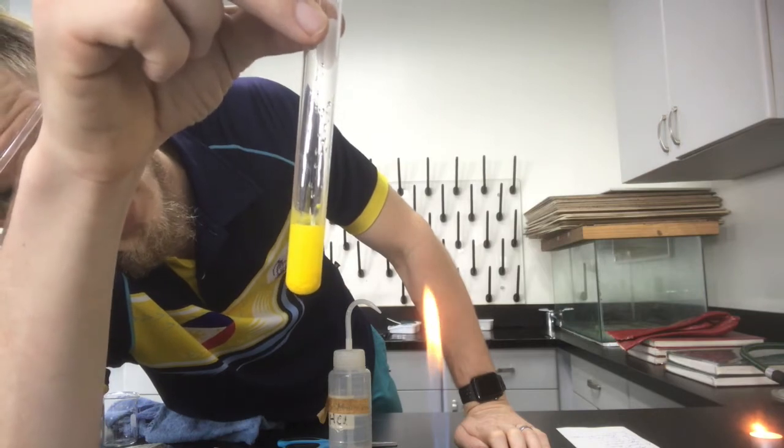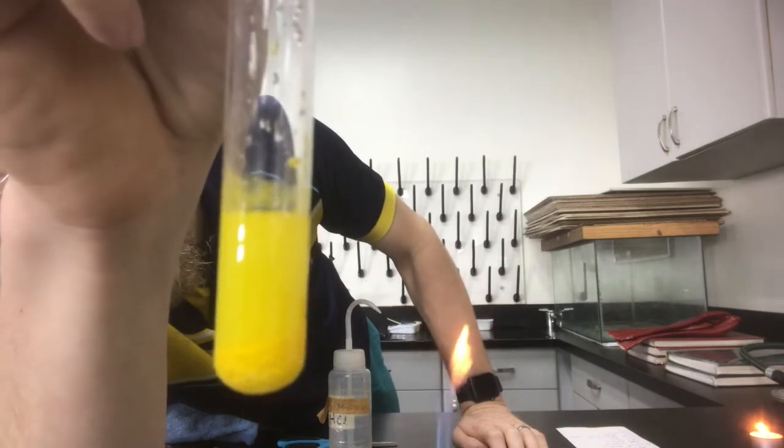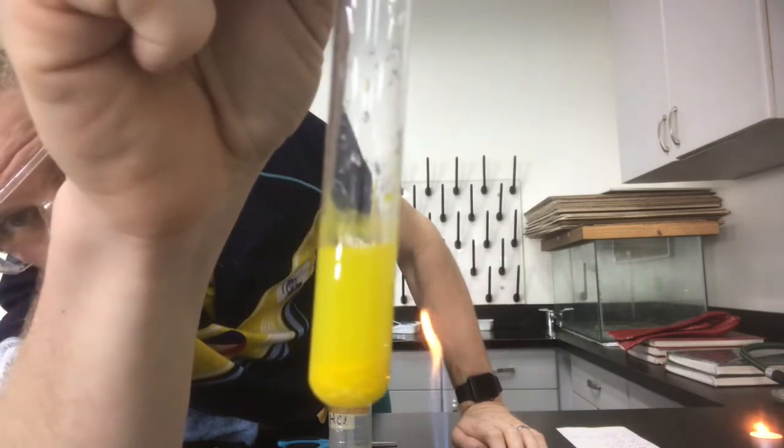It is happening, but it's probably very hard for you guys to see. You might be able to start to see it there come out.